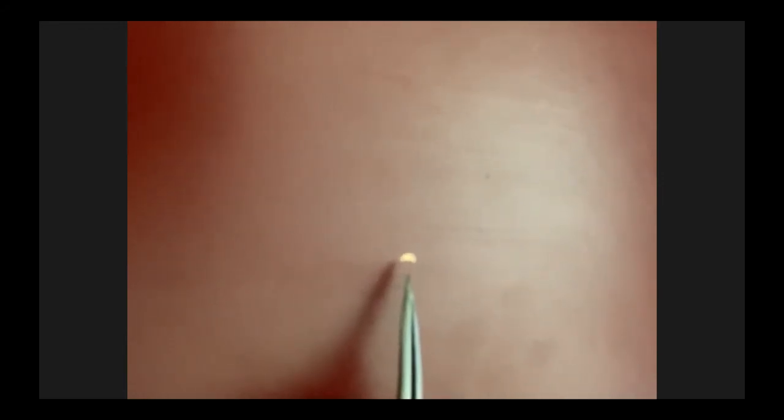It's this small part here. You can't see much at this resolution, but you have to believe me that there are 4 fingers where you can place your 8 lamellas. Very, very small, but still possible to work with. So I will pump the system and then you will see it in real time.